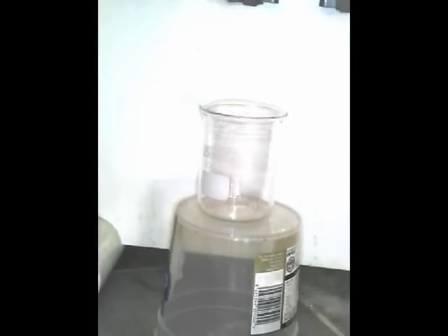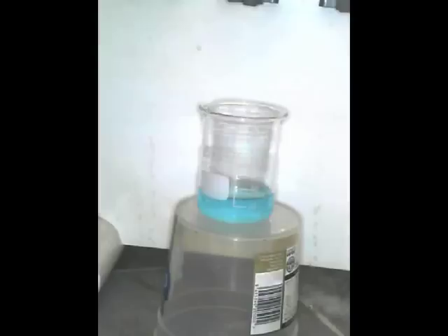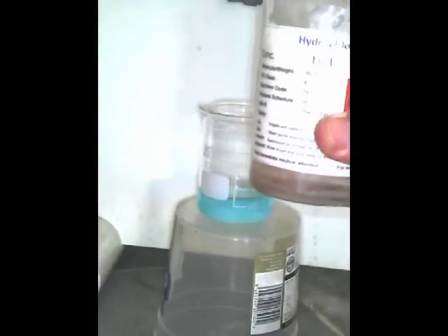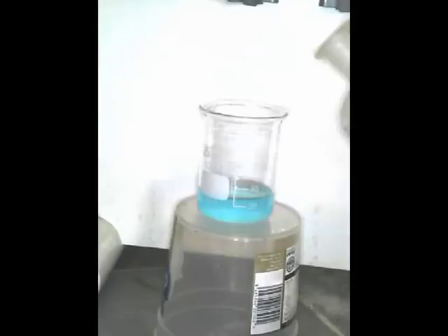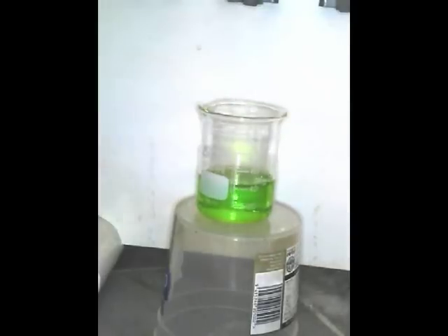Now this is live, so there'll be no misuse of the English language except by me. The only thing that concerns me about these little machines is the quality of the color that comes up here compared with what you can see there — not too bad. It's actually blue, which is quite unusual. In here we've got some copper(II) chloride solution, CuCl₂, and in this bottle here I've got concentrated hydrochloric acid. I'm going to add that in here to create an equilibrium, which produces that lime green color.